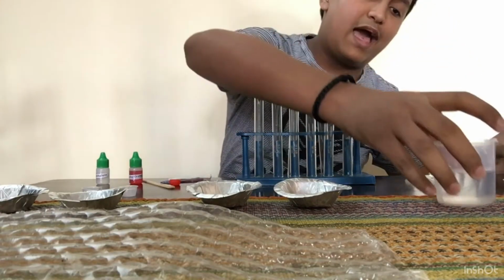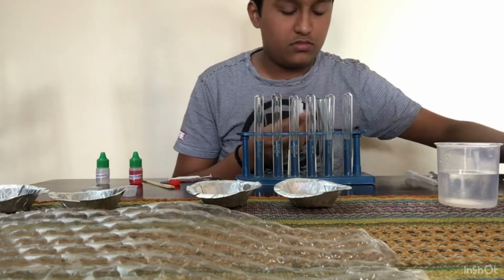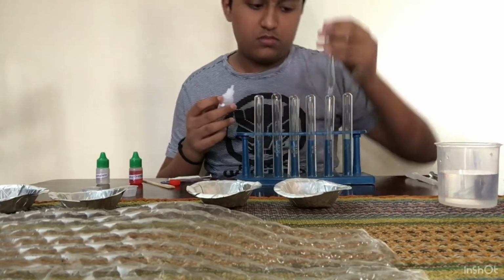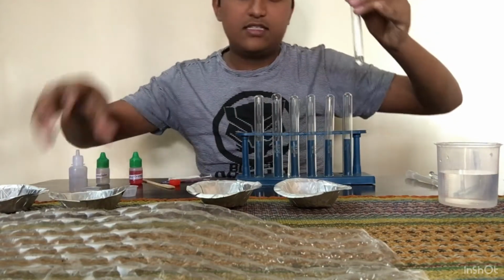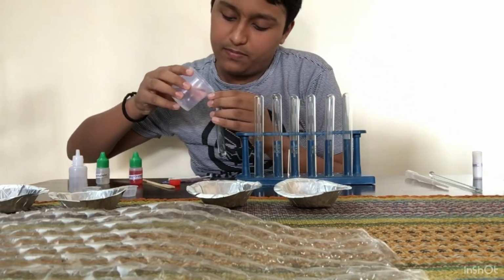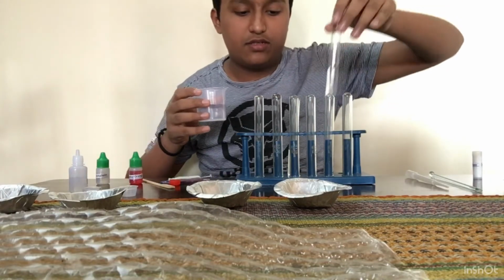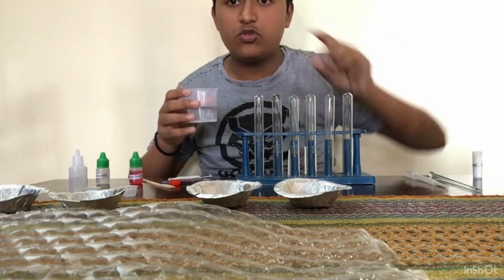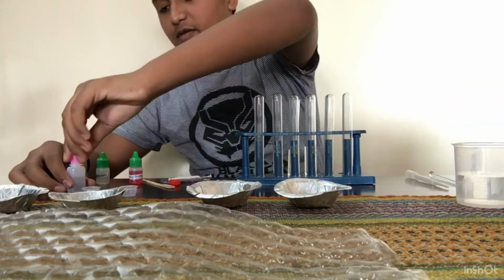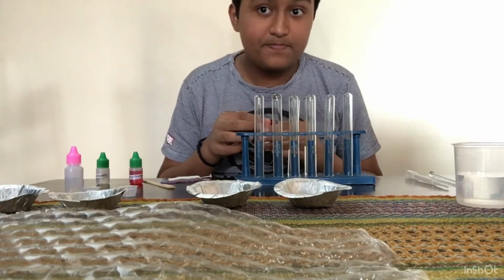Now let me take some acid in a test tube. Here you can see, and I'll just put some water because it's already in a liquid form. So here you can see I made a solution of this also. So I have two solutions here. Now I can check the solution in two different ways. Let me first close my chemicals so that they do not fall. Safety first.